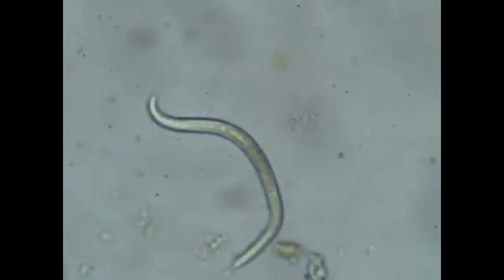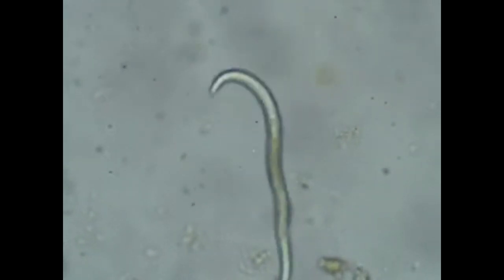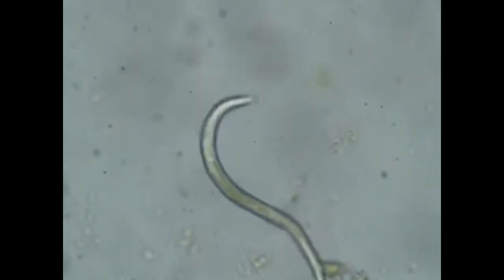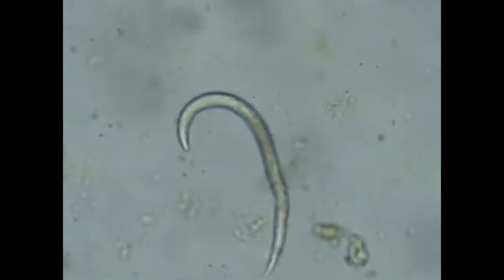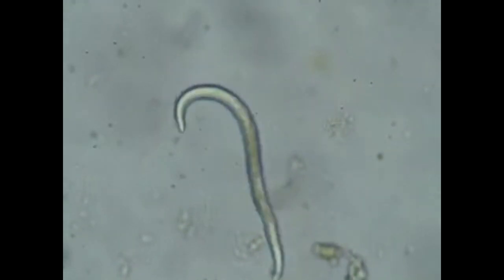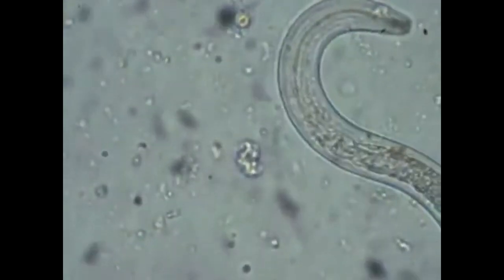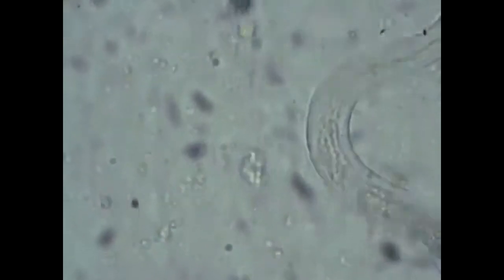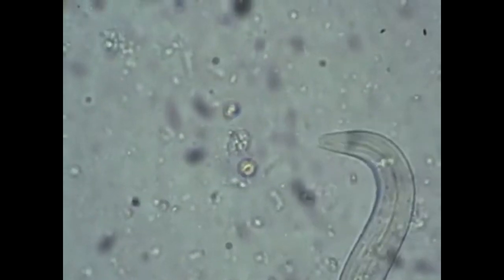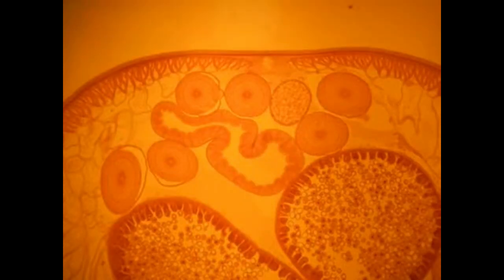The possession of two layers of muscles — circular and longitudinal — makes earthworms a little more complex than other worms. For example, nematode worms only possess longitudinal muscles and are more limited in the movements they can perform.